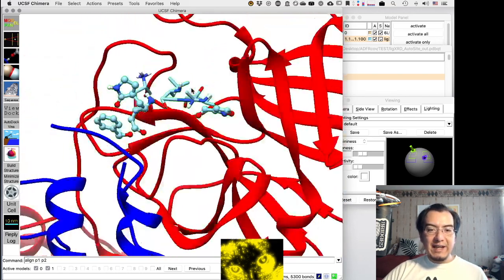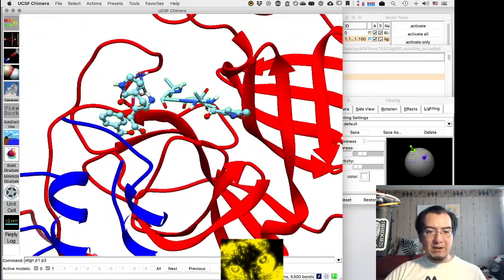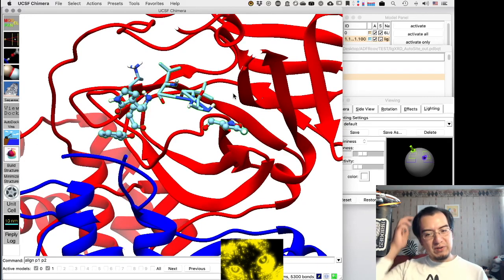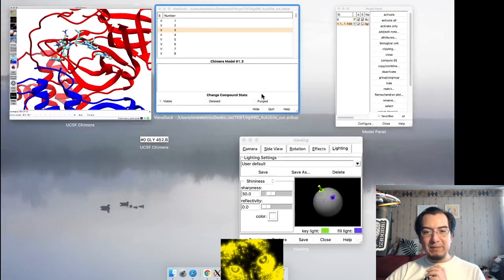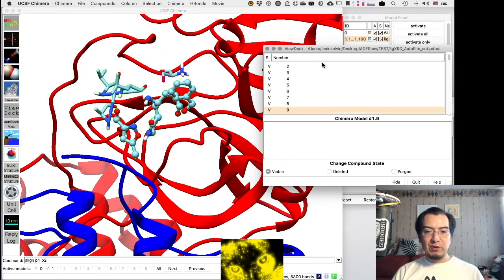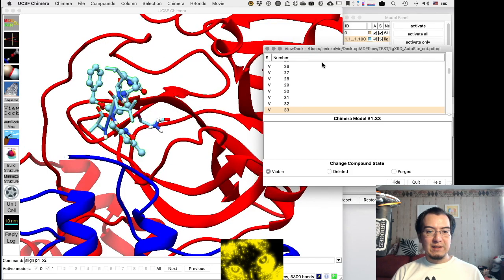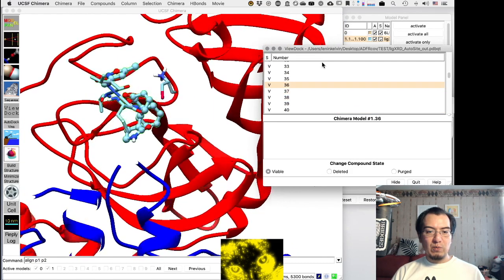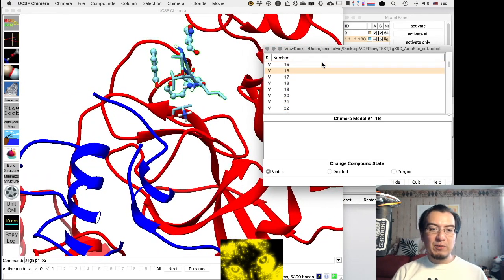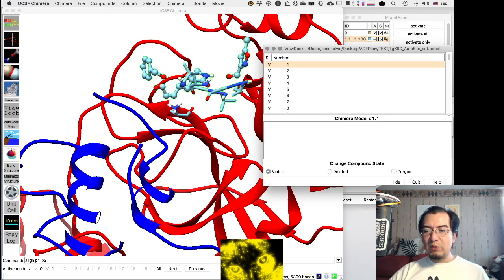Okay, this ligand is problematic because of this. The atoms get mangled because it's not a single continuous structure. But that is a problem of this ligand in particular. It can be fixed, but I wanted just to do this for the purpose of showing you how to prepare the files. Yeah, so we found a binding site with high affinity. Maybe none of this represents the perfect result, but at least I showed you how to do it.